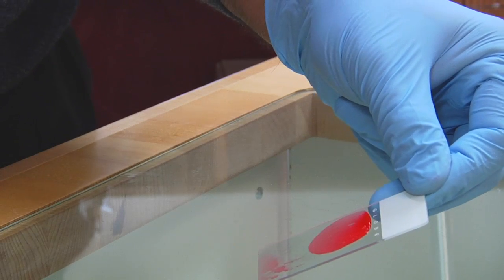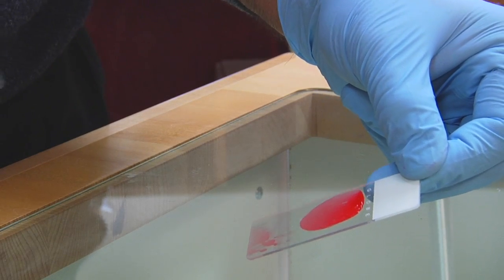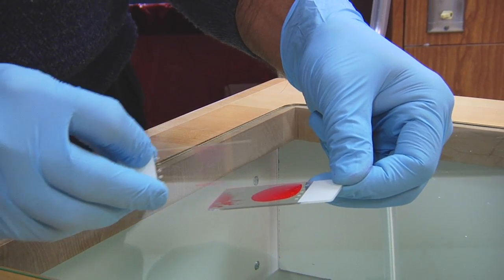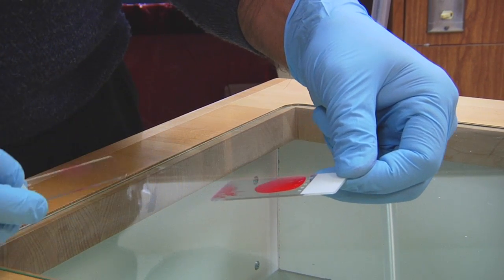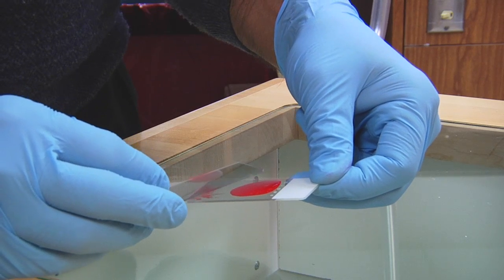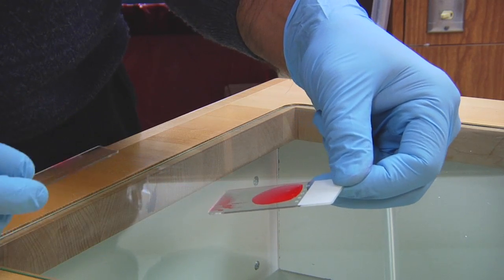As you can see it makes a perfect tongue-shaped smear. The advantages of this technique is that the aspirated material is spread evenly along the entire length of the smear with the maximum concentration of the material in the center of the smear.